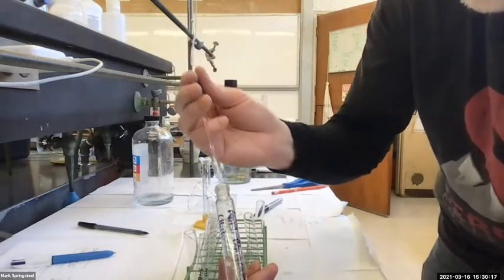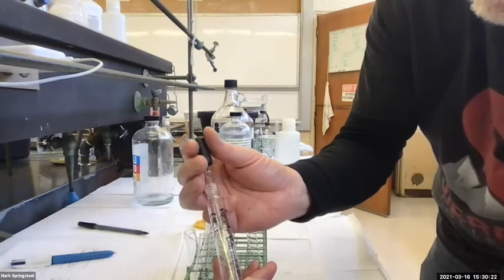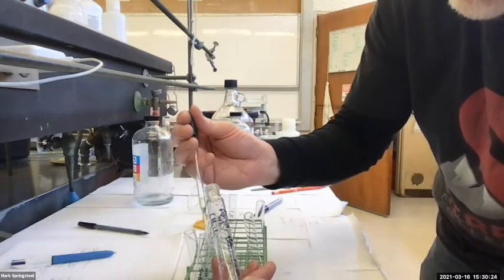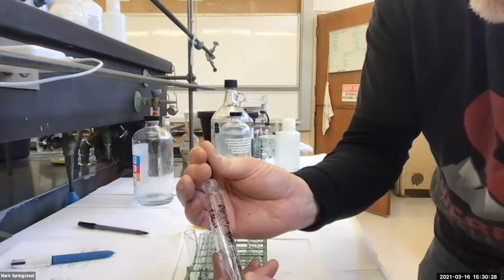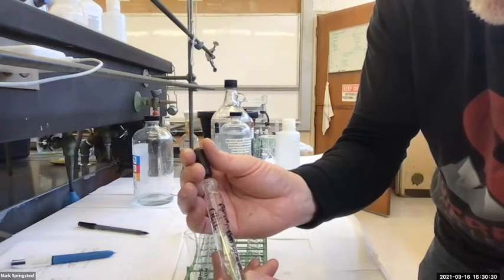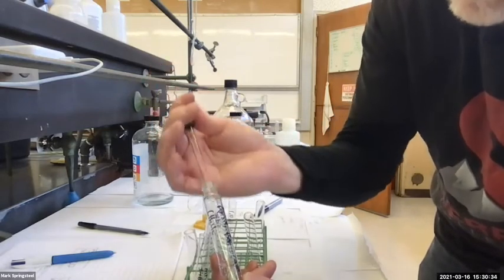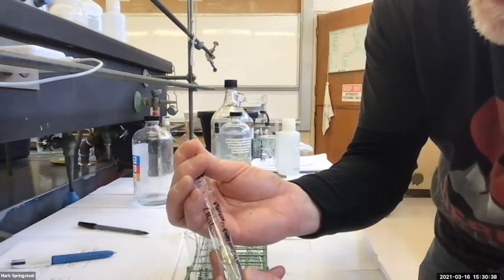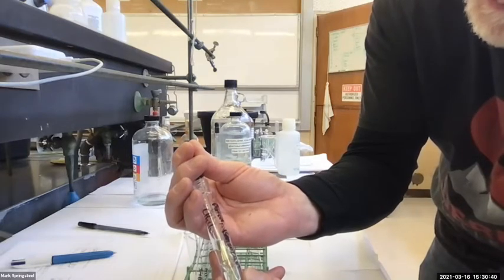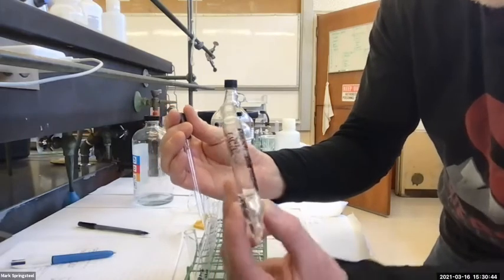It's looking pretty good. And see how the organic layer now is getting narrow on the bottom? It's going to be easier to separate these two because of the narrowness of the centrifuge tube. Now this part, I got to be careful. I just got to do my best. It's not going to be a perfect thing. You can't really see the bottom end of the centrifuge.